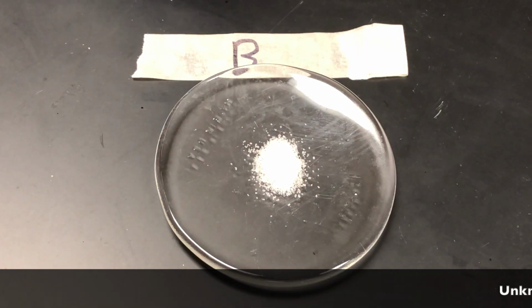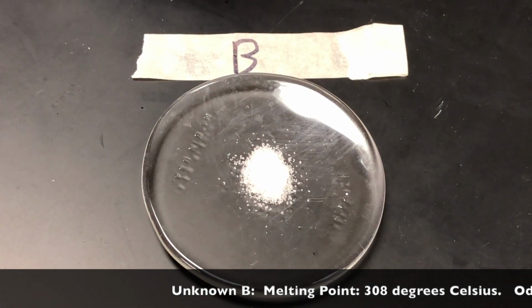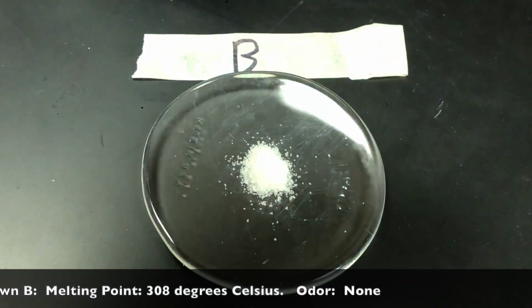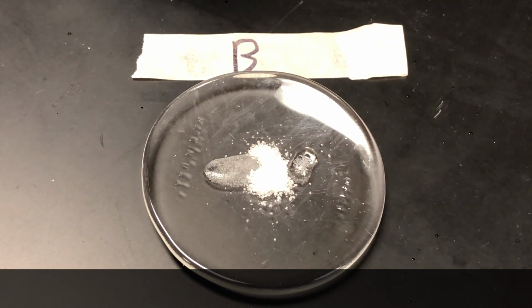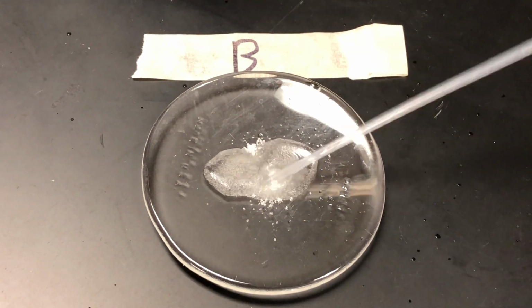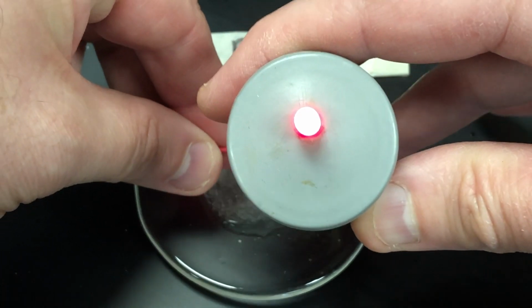The same tests were performed on unknown B. Please note the information about the melting point and the odor on the ticker below. You can see here, as a dry substance, there's no conductivity. And when we dissolve it in water, you'll see that it dissolves a little bit, but it does dissolve. Okay? And then we check the conductivity as it's dissolved. And as you can see, the light turns on.